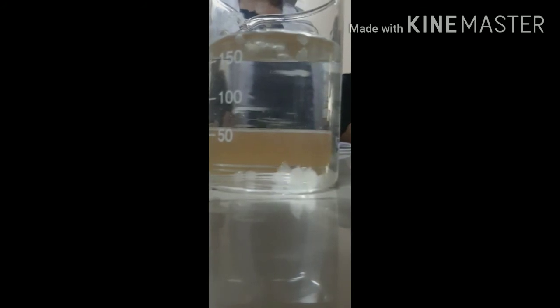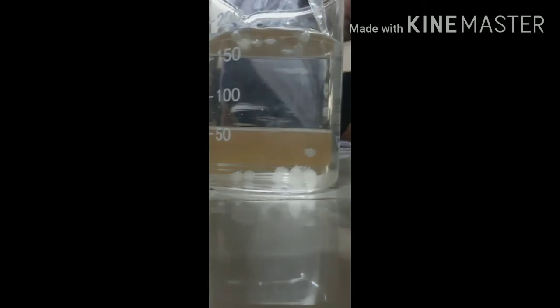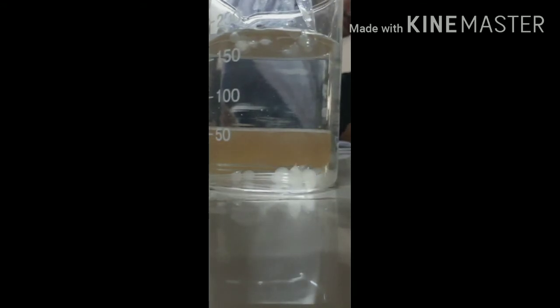How beads are formed: when the mixture of bacteria and sodium alginate is added drop wise to the calcium chloride solution.